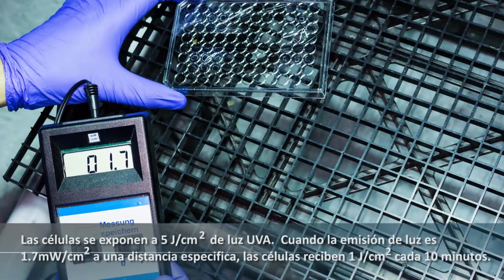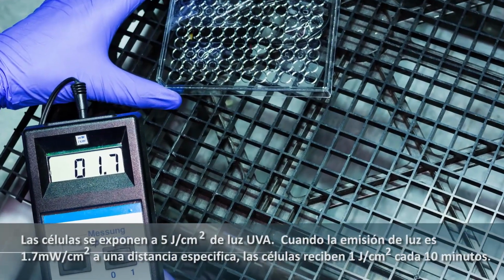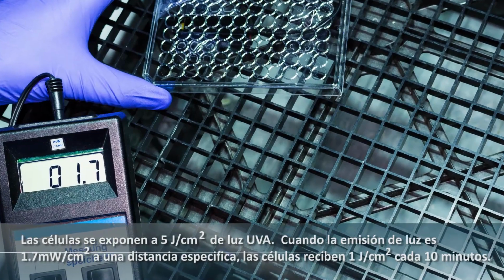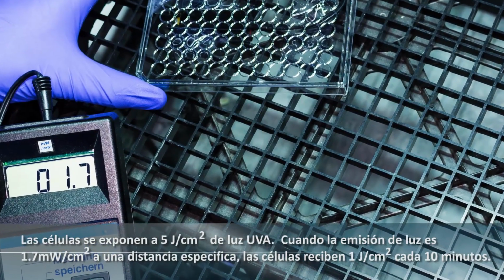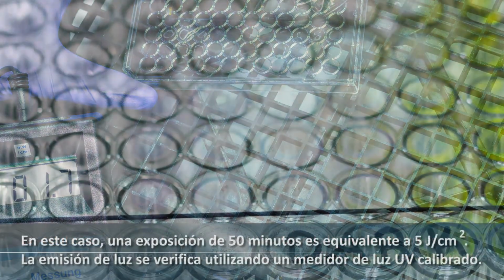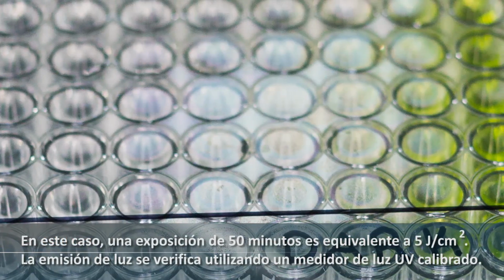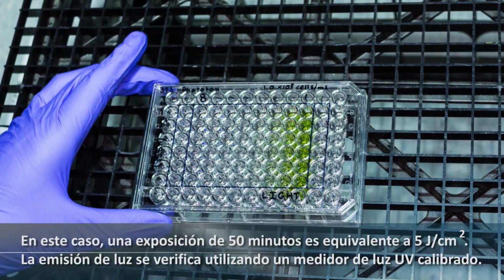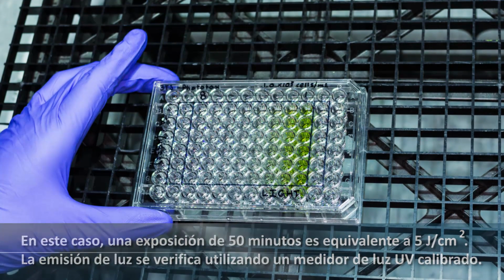Cells are exposed to 5 joules per centimeter squared of UVA light. When the light output is 1.7 milliwatts per centimeter squared at a specific distance, the cells receive 1 joule per centimeter squared every 10 minutes. In this case, a 50-minute exposure is equivalent to 5 joules per centimeter squared. The light output is verified using a calibrated UV light meter.